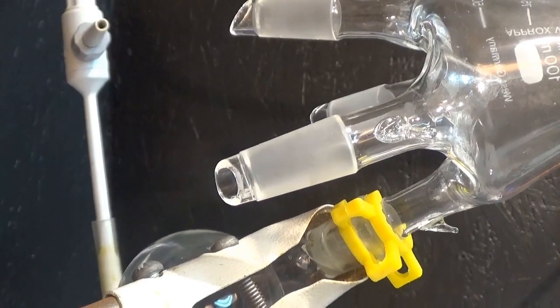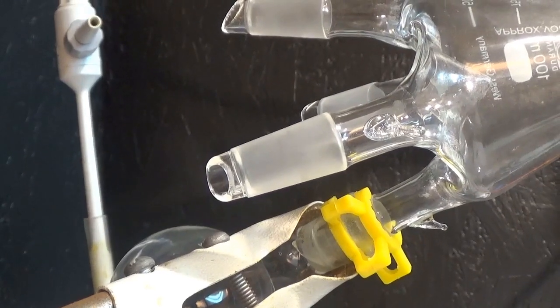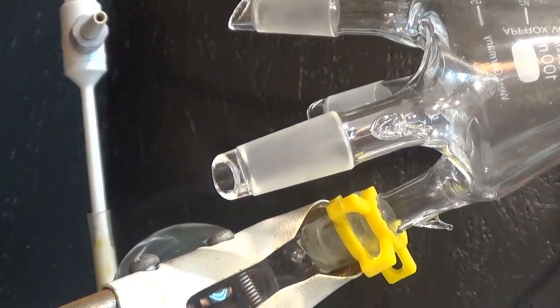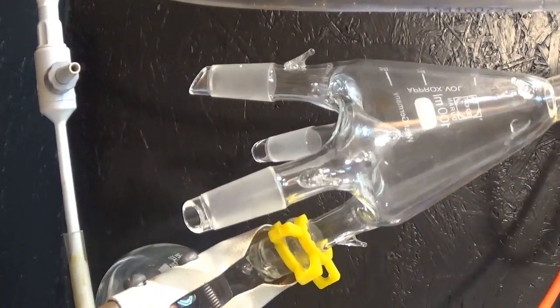There is a considerable amount of gases dissolved in the pyrolysis oil which can be seen at the adapters of the distilling spider. These gases are driven out of solution during the distillation due to the decreased solubility in hot solution.